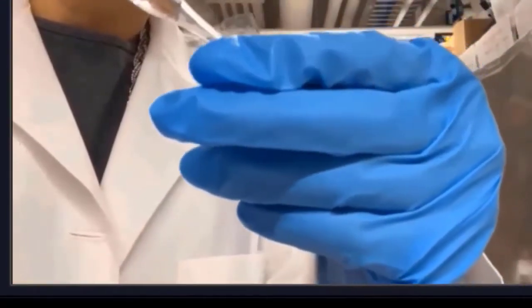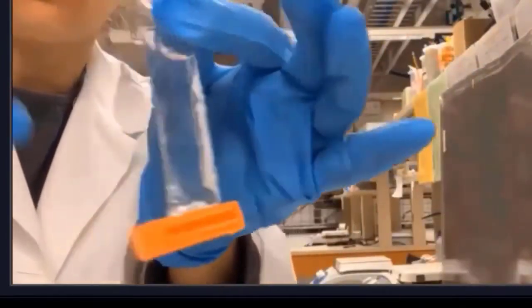Check and make sure that it is not leaking. I am going to fill up bag A with 10 milliliters of 1% sucrose. As you see here, I am folding the opposite end and using a dialysis clamp that is already labeled A to seal it. Check and make sure that it is not leaking.